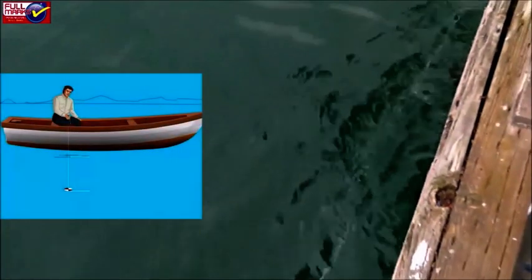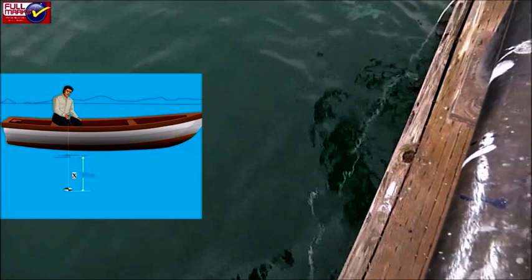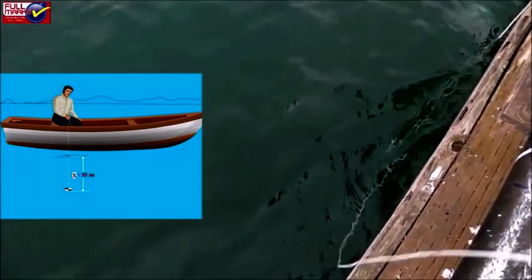Reach the center of a nearby pond in a small boat. Now slowly immerse the Secchi disc into water, holding the rope tightly, till the black and white segments of the disc disappear. On reaching a particular depth, the disc becomes completely invisible. Now mark the length of the rope with the help of a pin when the disc disappears, say x centimeter.